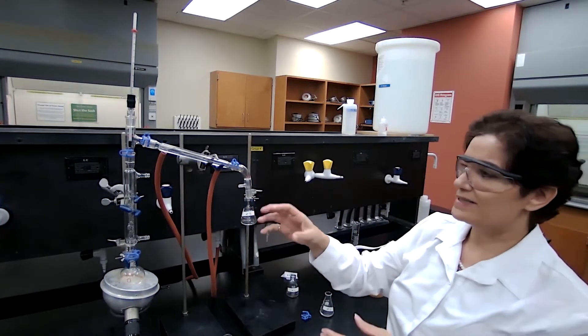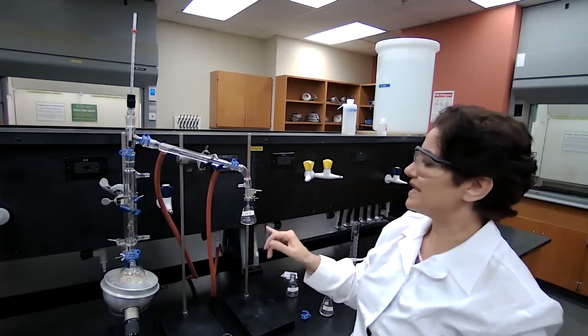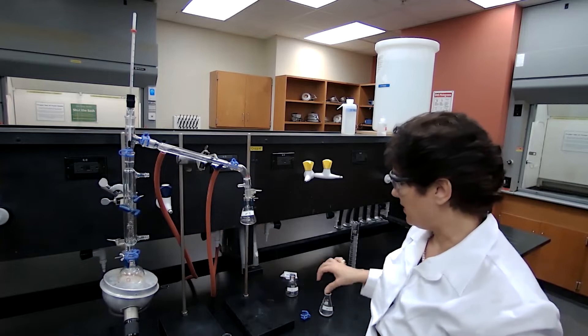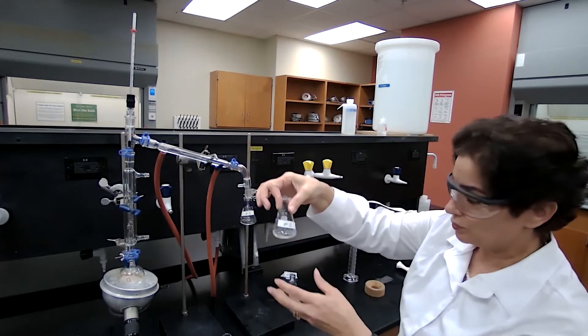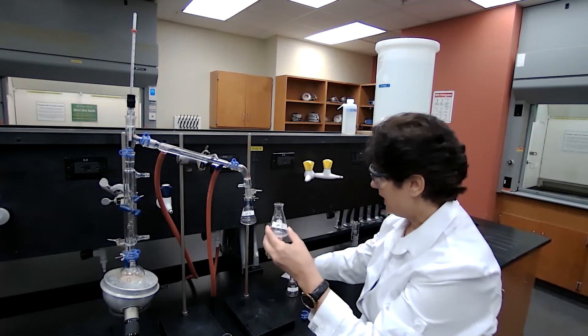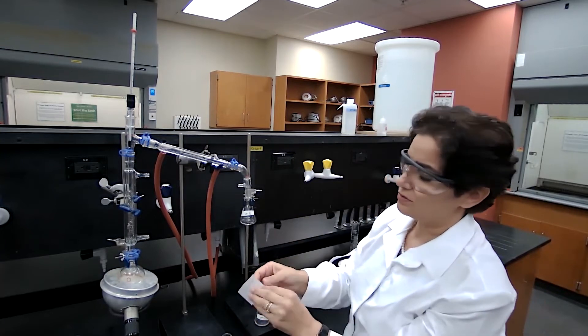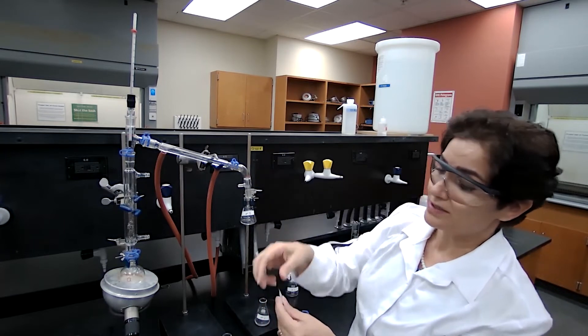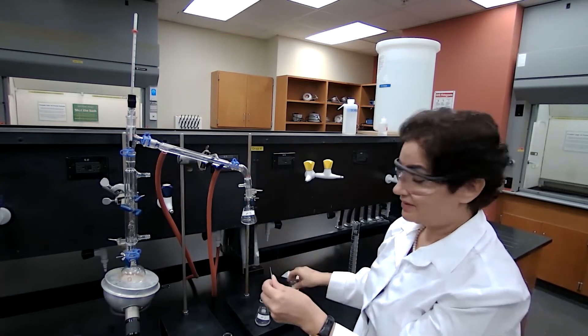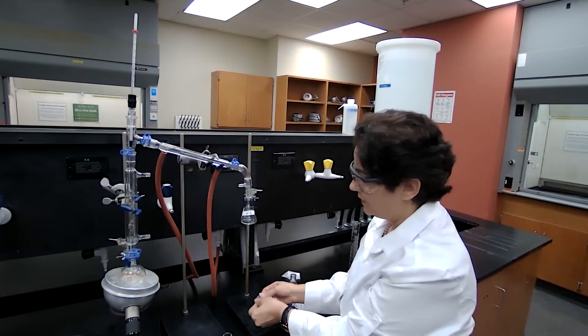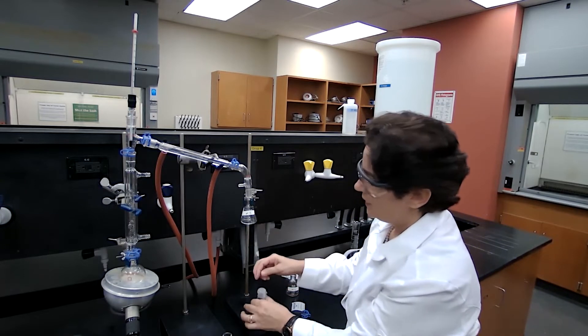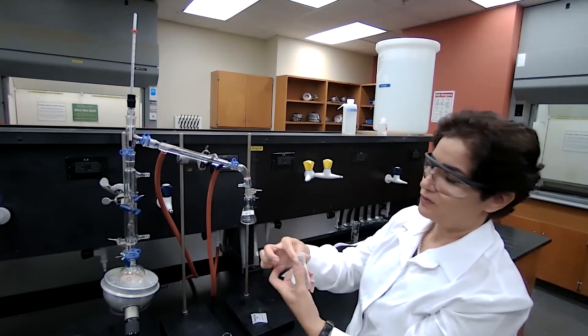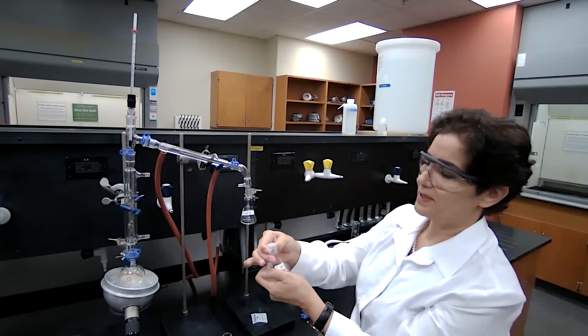Fraction three, as I said, is between the two samples. I just want to make sure that I'm not getting of the second compound mixed with my fraction two, which is my pure sample. I need to measure the mass, I need to measure the refractive index, and I record the temperature of 57 degrees for the boiling point of the first fraction. So I'm going to cover it just using parafilm, so it doesn't evaporate while I'm finishing up the experiment.